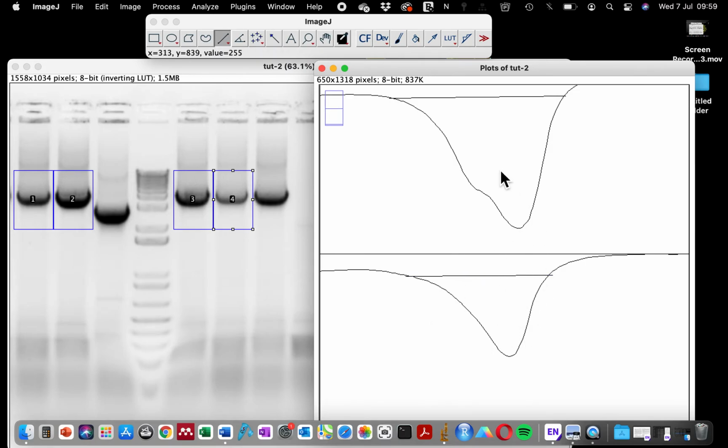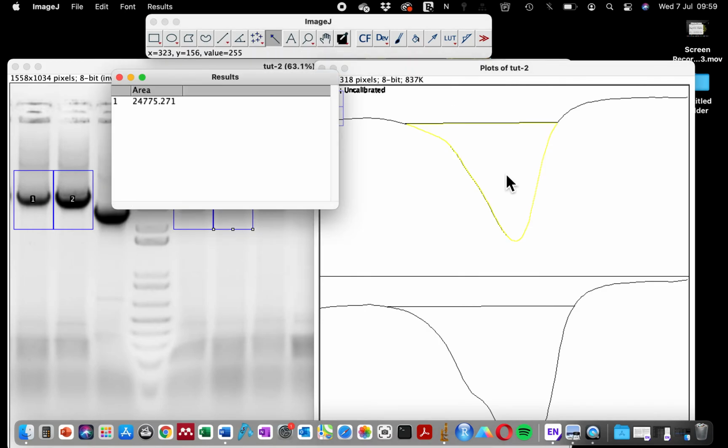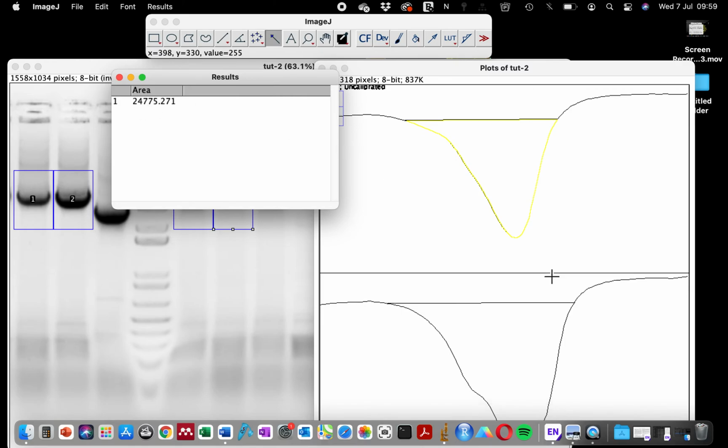So now we've drawn these four lines. And the next thing we need to do is to select our magic wand tool. With the magic wand, when you click inside the peak, it recognizes the peak and it stops the quantification at the base. You can see this yellow line around the peak.